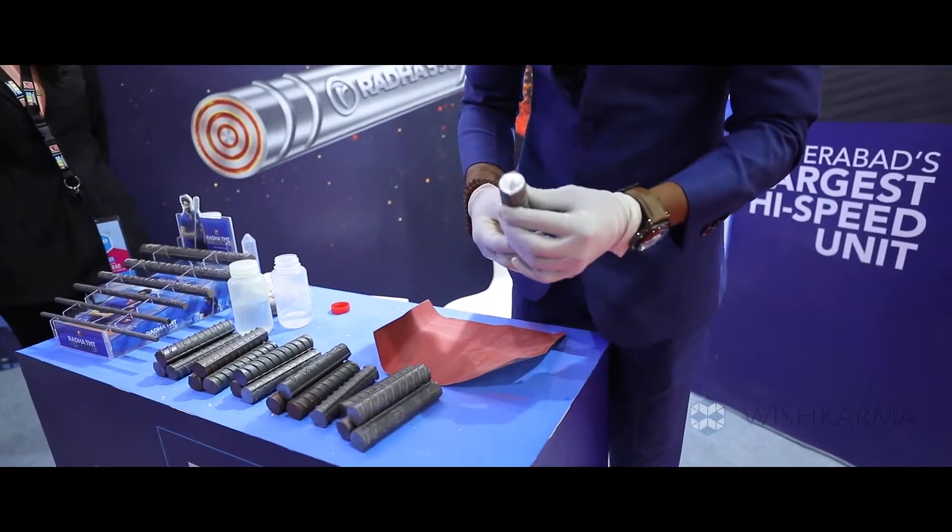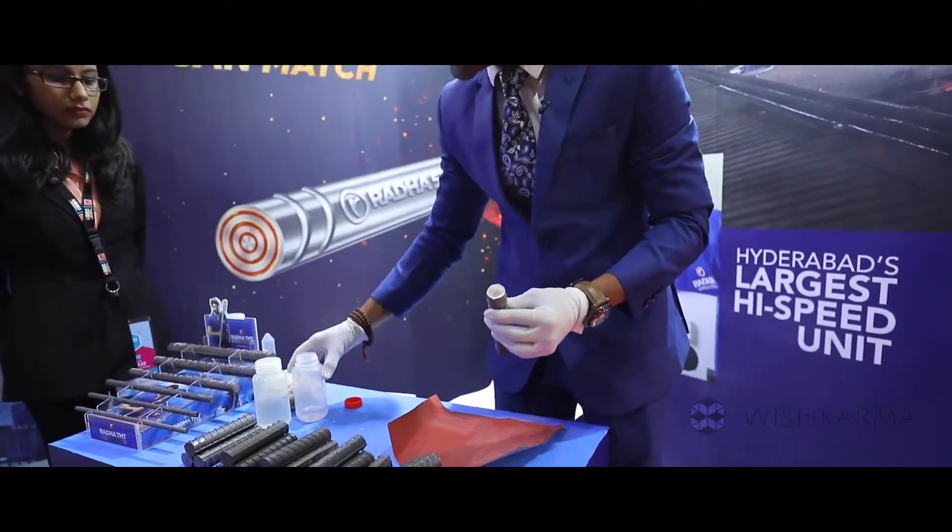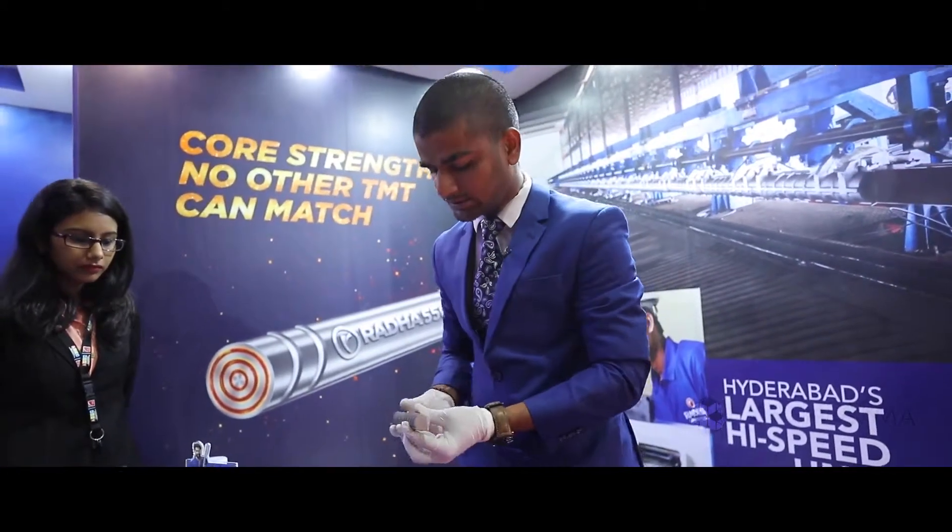After the rod comes to this mirror image, you just need to dip it in the solution for 5 to 10 seconds, like this.